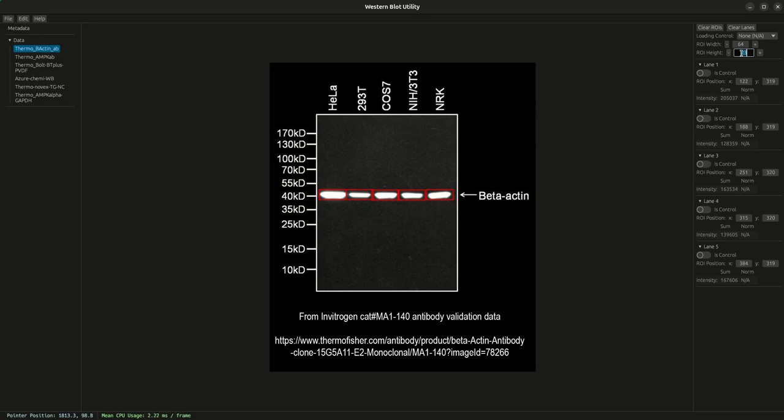And if I didn't want to do the manual increment with the plus and minus, I could just type in a value as well. It's important to call out that everything is adjusted relative to the centroid. So if you were to increase width by 2, obviously it adds 1 pixel to the left and 1 pixel to the right. And then if you're adjusting the height, then it adds 1 pixel to the top and 1 pixel to the bottom. And then if it's just 1, it alternates between which sides you're adding to. So if I were to add 1, it adds to the left, and then add another one, it adds to the right. It oscillates. So that's how you adjust the width and the height.